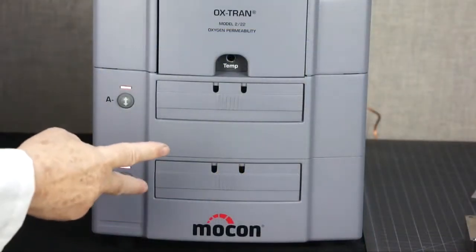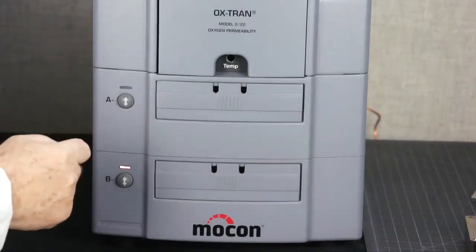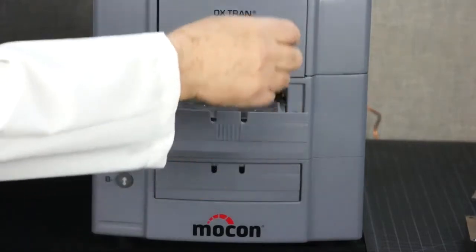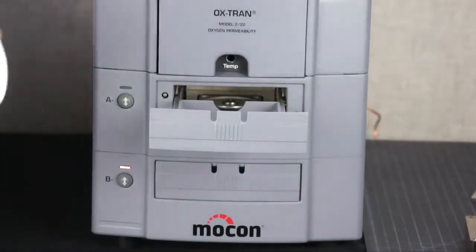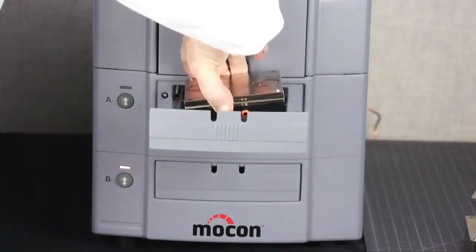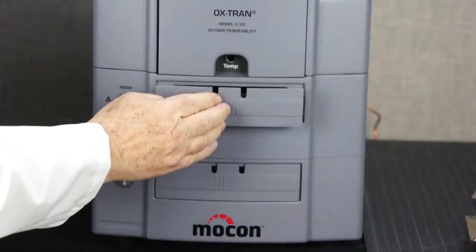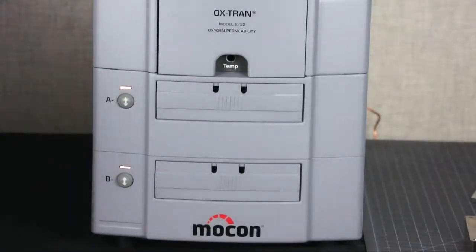The two horizontal cell drawers slide out at the touch of a button and allow you to remove the cell for easy placement of the film while the cell is on the bench. The cells clamp pneumatically at the touch of a button, eliminating any chance of repetitive strain injuries and ensuring a consistent clamping pressure every time. We have added a cell clamped indicator so you'll know the cell is properly closed.